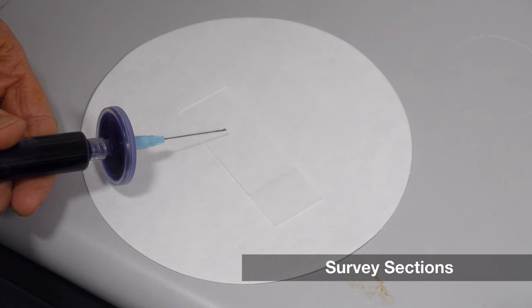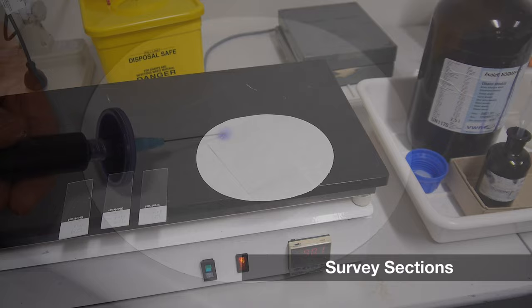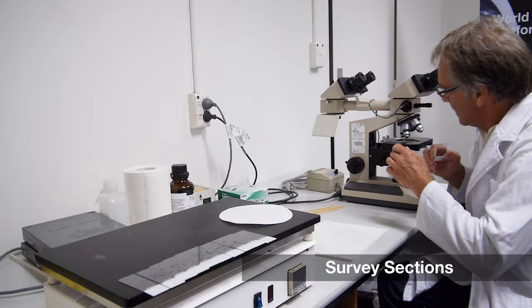They are transferred using a fine pipette tip onto a drop of toluidine blue stain on a microscope slide. The slide is dried on a hot plate and then viewed with a light microscope.